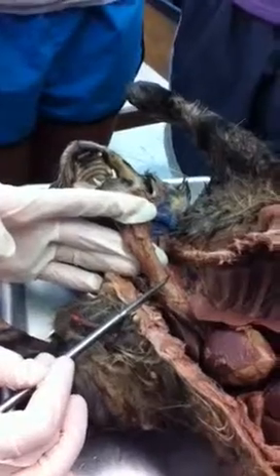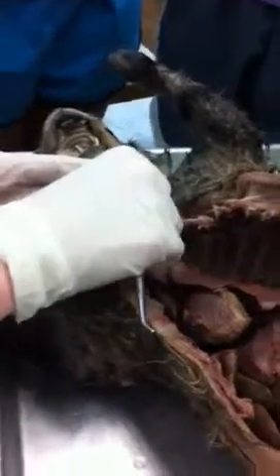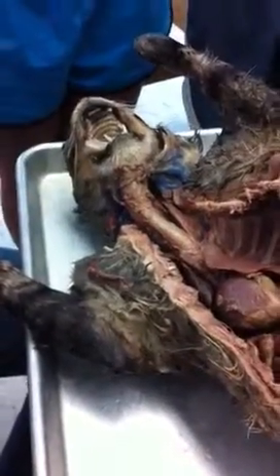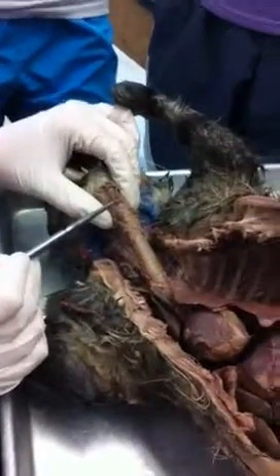Cartilage. What kind of cartilage? Hyaline cartilage. Why is it in a C shape? So it can expand, to allow food to kind of expand into the esophagus, but not within the trachea. Excellent. So we're in the trachea, past the, what's this called again?